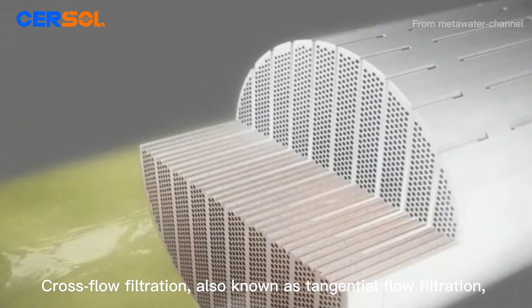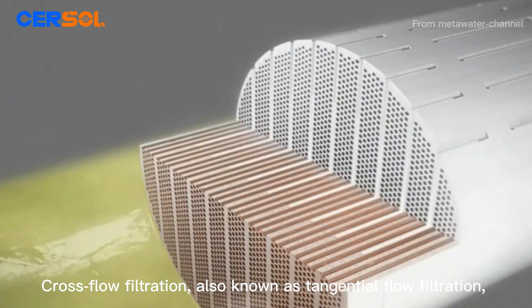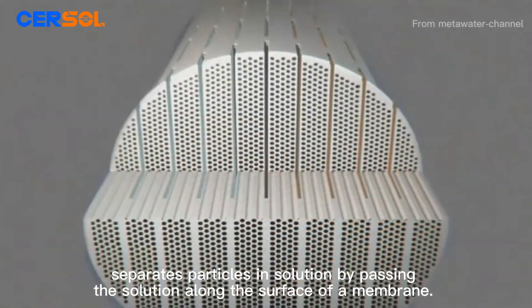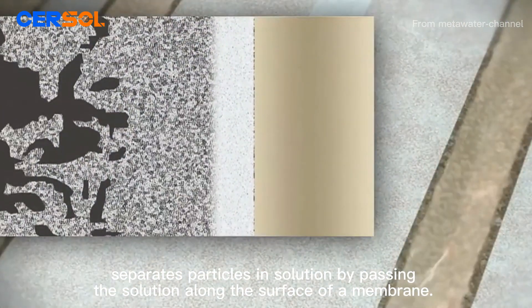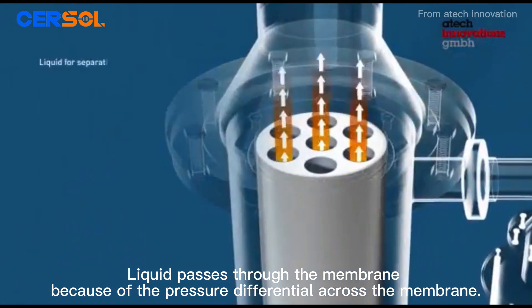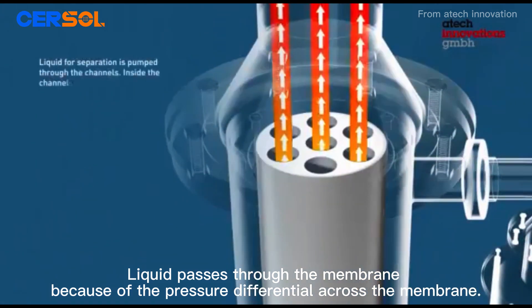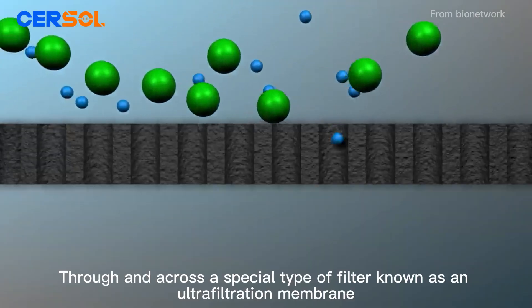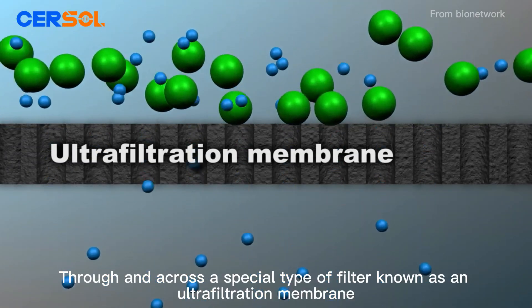Cross-flow filtration, also known as tangential flow filtration, separates particles in solution by passing the solution along the surface of a membrane. Liquid passes through the membrane because of the pressure differential across the membrane, through and across a special type of filter known as an ultrafiltration membrane.